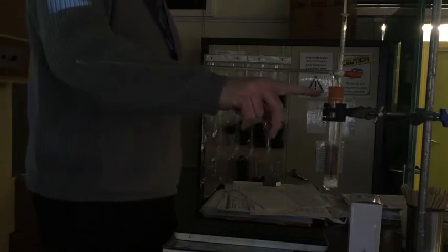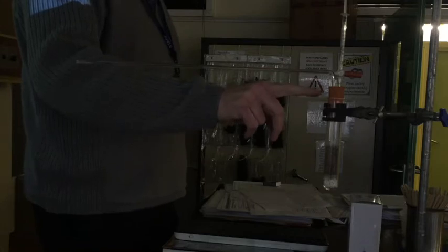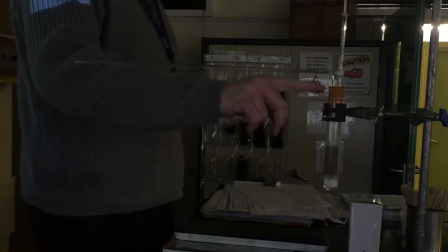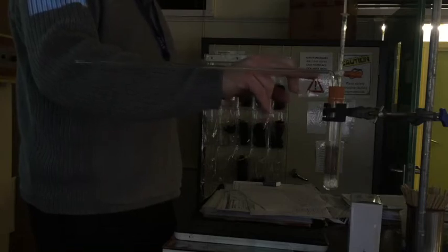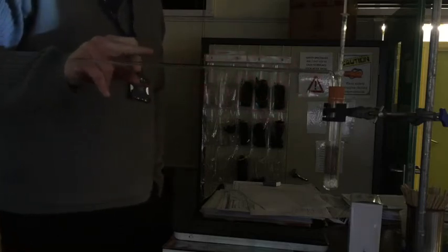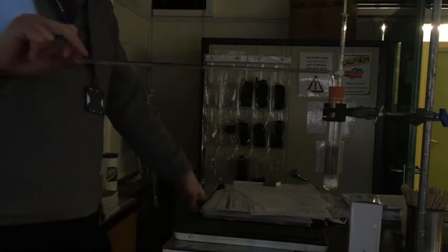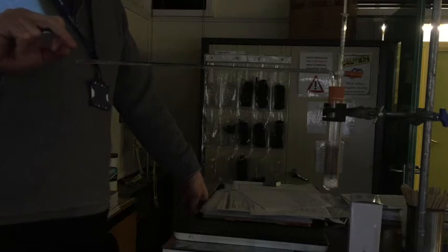Now attached to that, we've got a sealed, and this is really important, a sealed bung here. We should put a little bit of extra vaseline around to seal it. And we've got a capillary tube, which is a very thin tube, and we've already set this up. This very thin tube contains, just over here, you've got a small amount of a red dye. Now this is just red food coloring with a little bit of washing up liquid added to give it a bit more viscosity, so it's a bit more stable. But basically it's just a bubble.